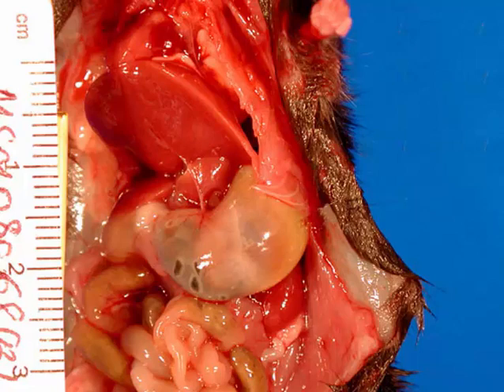Gastric ulcers. It is stressful being a laboratory animal. There's no denying that. And we saw something that could be gastric ulcers before. These are fairly classic gastric ulcers, most commonly present in the pyloric stomach. I'm a big fan of the pyloric stomach. There's not much that happens in any other part of the stomach in most animal species. But ulceration most commonly occurs at the areas where the acid pH of the stomach meets the basic pH of the small intestine. And blood vessels there tend to run a little closer to the surface.